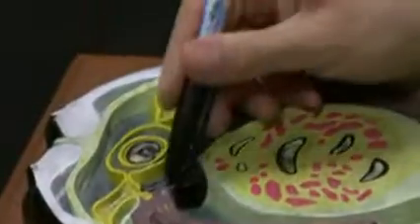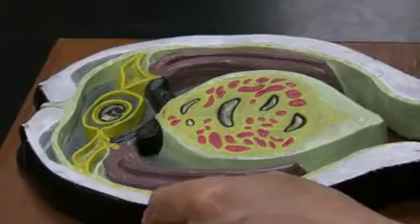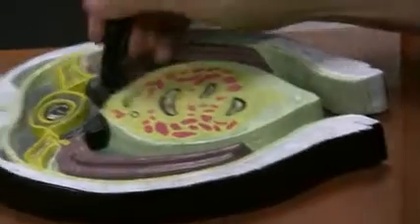Okay, and underneath, this is gonad. Oh, sorry, kidney. Sorry about that. You're right. Gonad is here. Kidney. Very good. I don't want to confuse you. Kidney. You're right. Kidney. Next one, please.